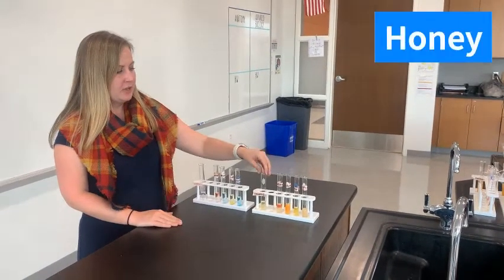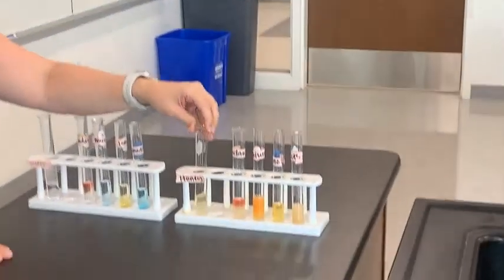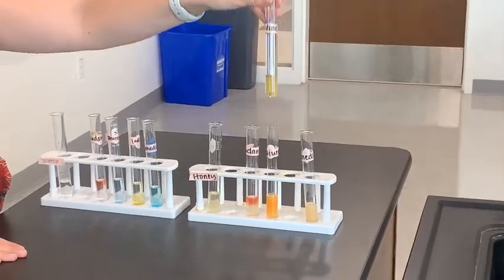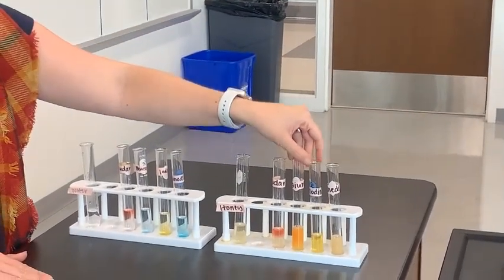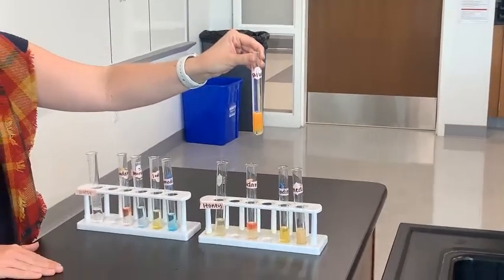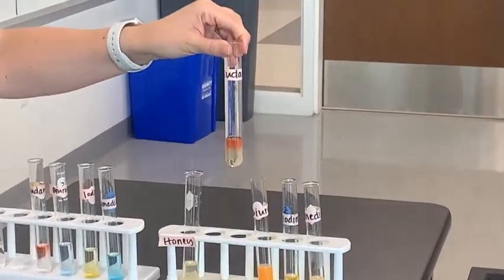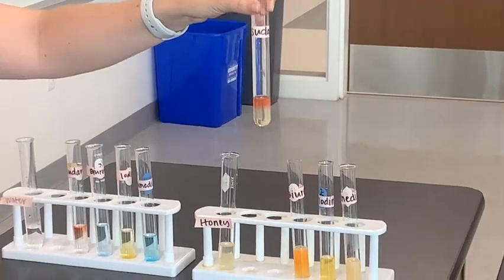Our next known sample was honey, diluted with water a little bit to help with the test. With Benedict's, you can definitely see it changed from blue to a yellow-orange color. With iodine, it's still that pale yellow-brown color — not a lot of color change. With the Biuret test, even though there was a color change, it's not the purple we're looking for, so protein is not indicated. With Sudan, it's still a very light red — maybe a little color change, but not a ton.